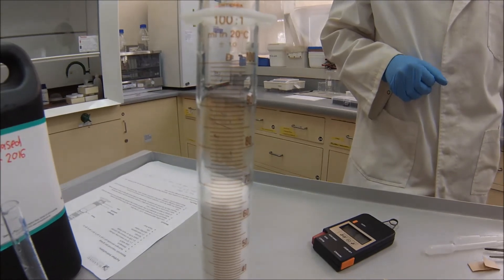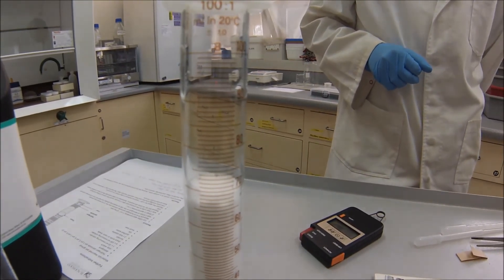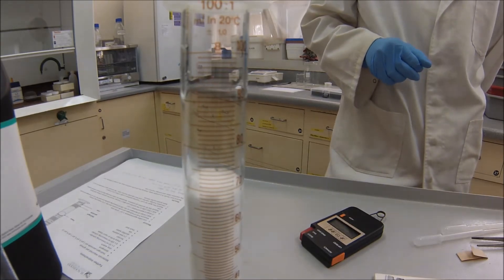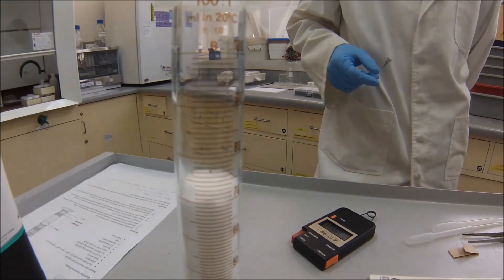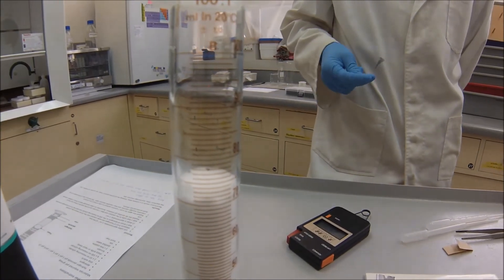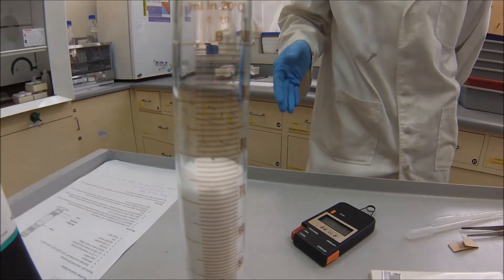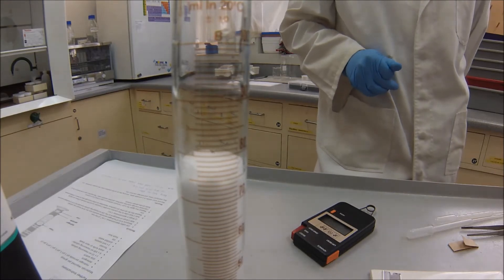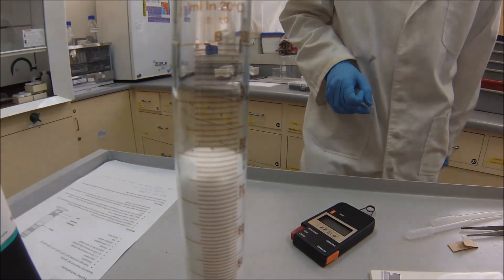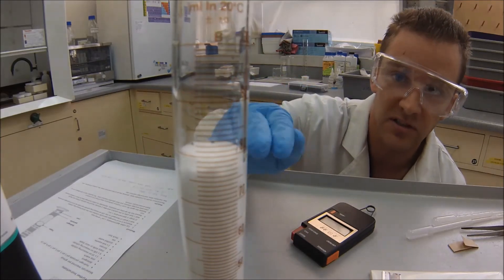What are we up to now, Dr. Johnson, in terms of time? Alright, so this is a minute thirty-six. So we're approaching the end of our two minutes. Of course, if we let it go, it's going to keep going after two minutes. But the purpose of this practical, of course, is to look at the rate of the reaction. So the total amount of gas produced after an hour isn't so much important. We just want to see how much gas is produced within a fixed time frame. So we're almost at the end of two minutes. So you get ready to look at the level and then you would record it. So two minutes is just now.